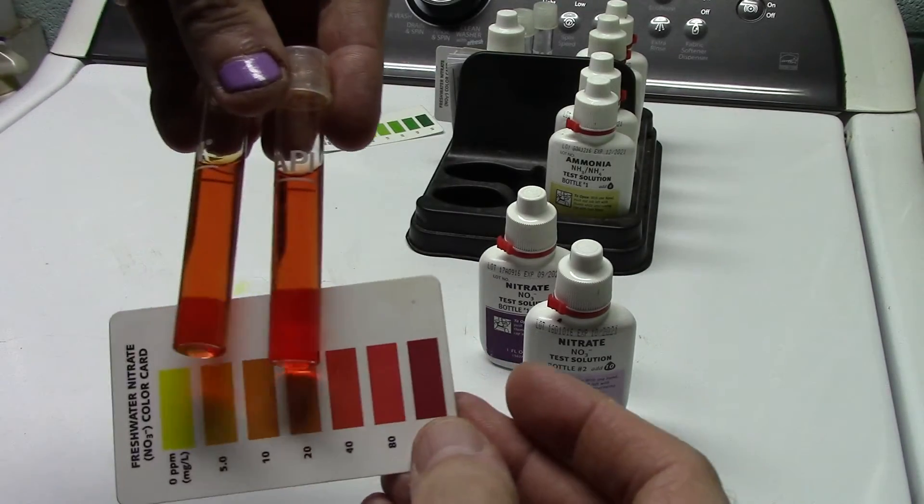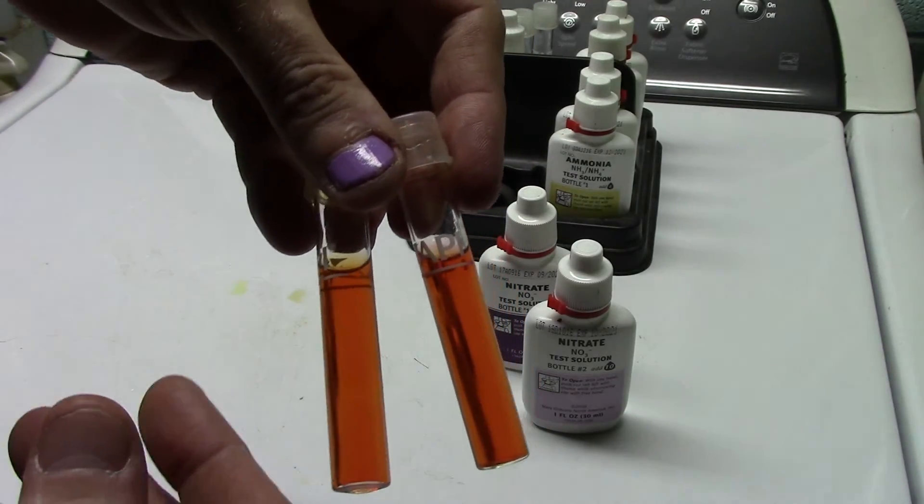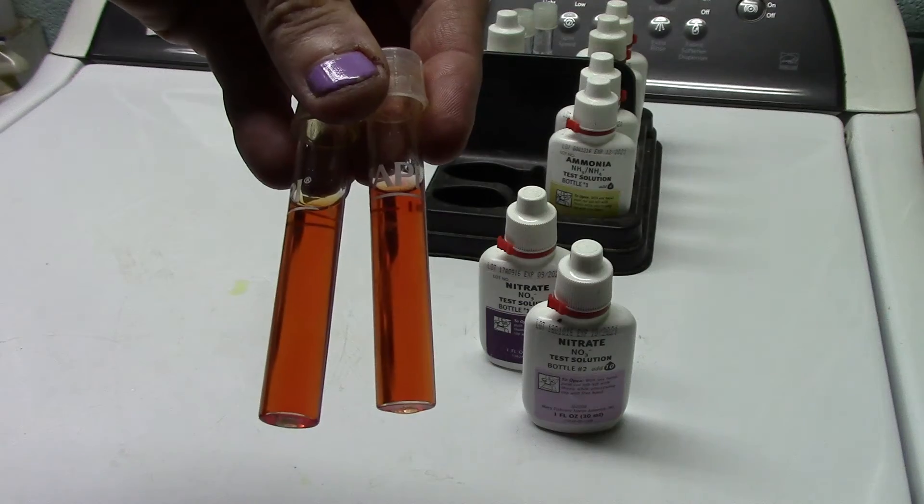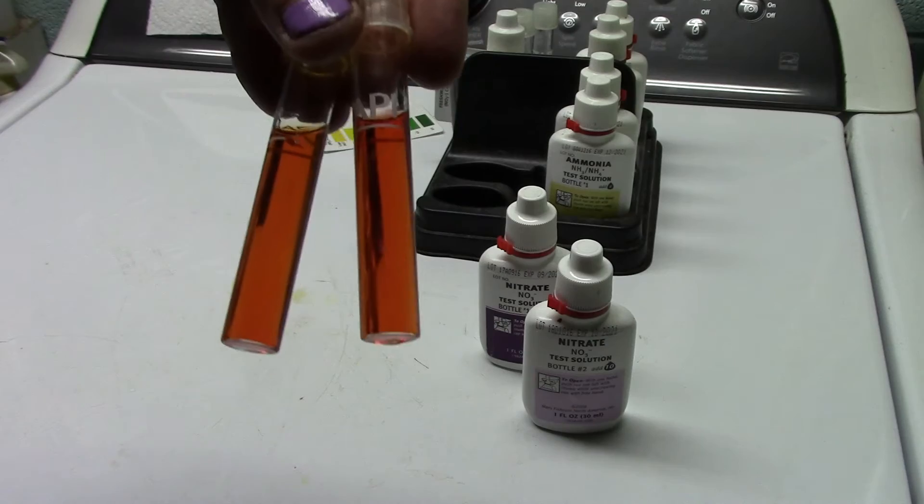But I mean, you can see them against the card side by side, they are absolutely identical colors. No difference whatsoever. You can use the card, you can use the background, you can hold them against the card, they are exactly the same colors.